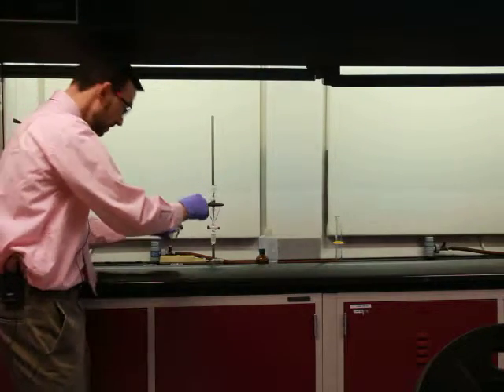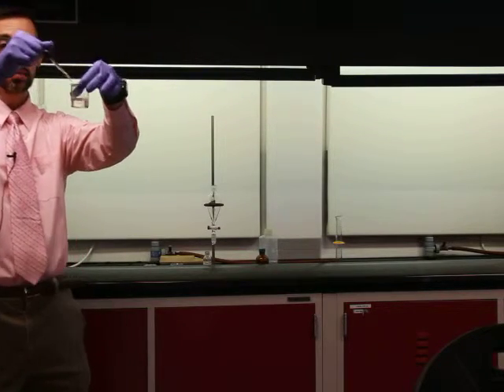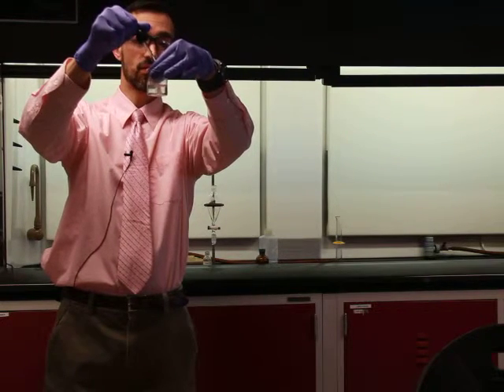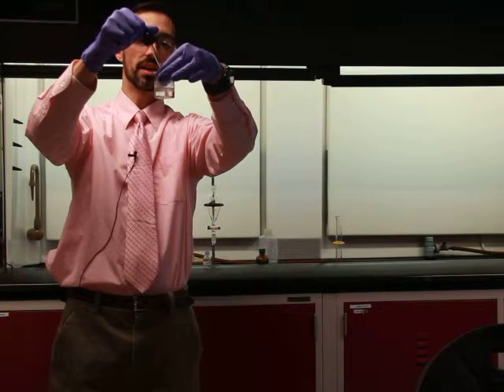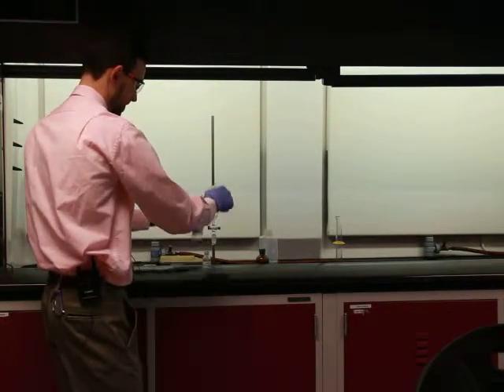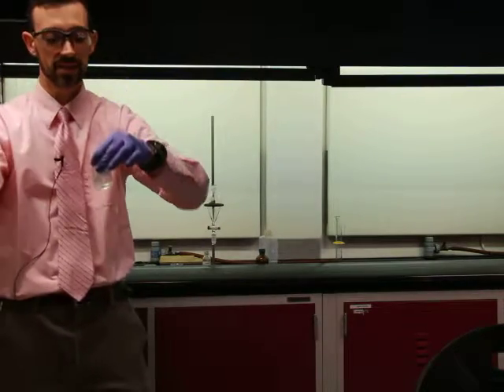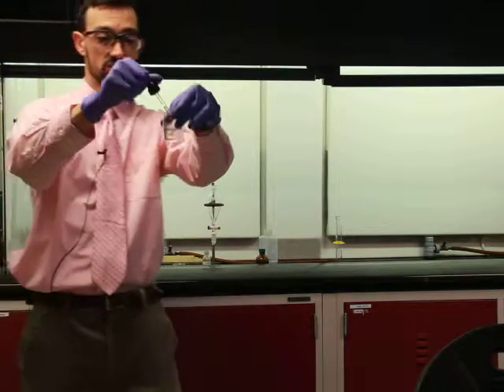Okay, and so it's not until we change the acid that we're able to get it to go into the water. So I can drop some concentrated hydrochloric acid, and I don't know if you can see it. As this drops in, you can see little white puffs forming. That is the acid forming, but it's such small quantities that it's still slightly soluble in there. So if I add enough acid in here, I will overwhelm the solution, and there'll be too much acid and it'll become insoluble. Yep, and it starts to precipitate out of solution.